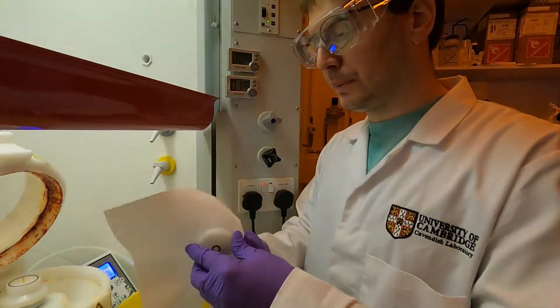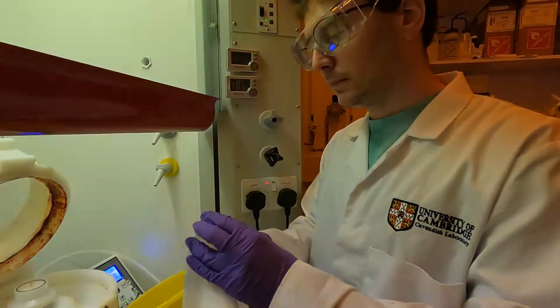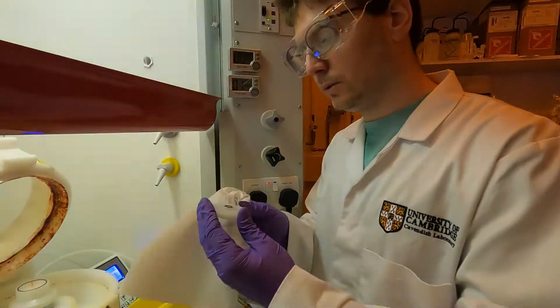I'm going to give this a quick wipe with a bit of acetone or isopropanol just throughout on all sides.